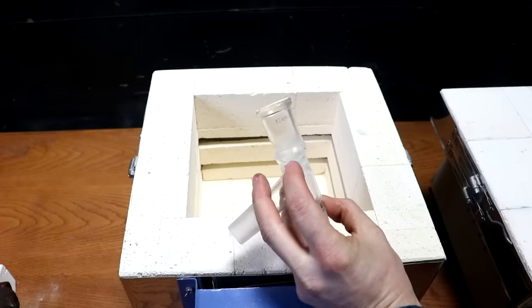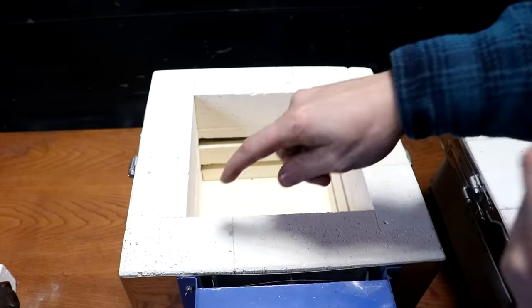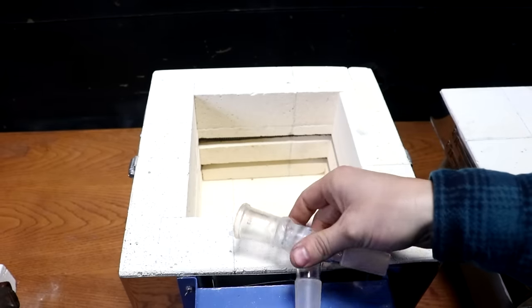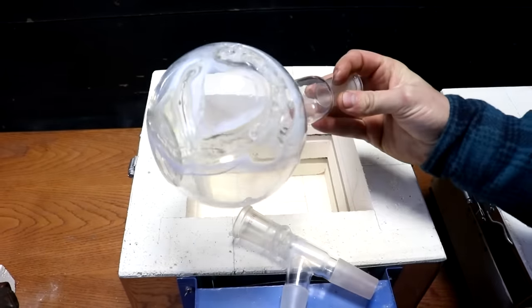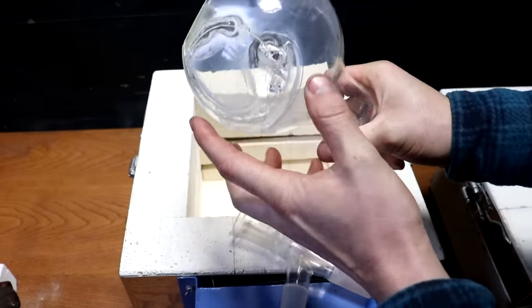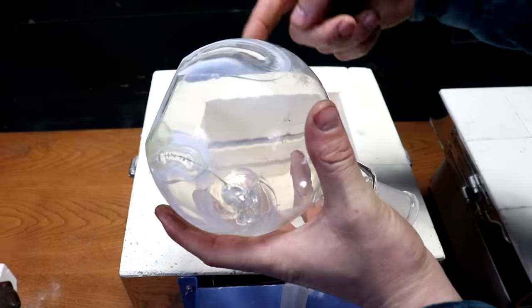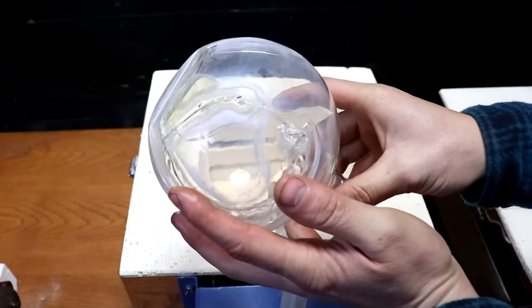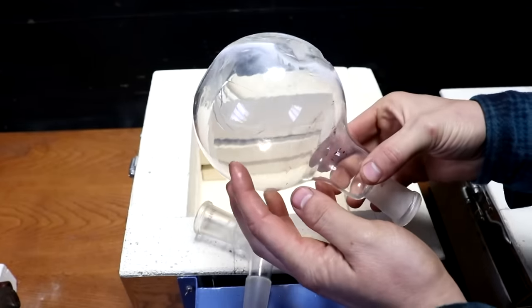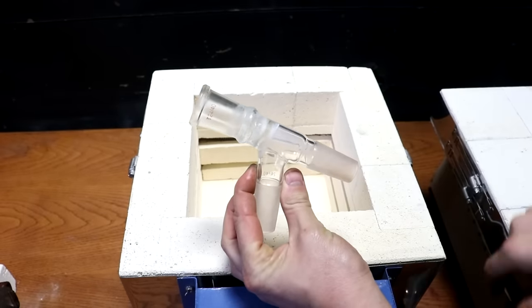So I've tried to repair glassware before. I think this might be the first time I've been successful. Definitely helped to be able to put it inside the furnace for it to cool down slowly. The large flask, I was not able to salvage this, probably because it's just too much. You know, while I'm heating over here, it's cooling off in the air. Maybe if I could have had somebody else with a torch blowing on it to help keep it more evenly heated. Let's be honest, this was pretty ambitious. I didn't expect it to work out. But for small things, looks like it works pretty good.